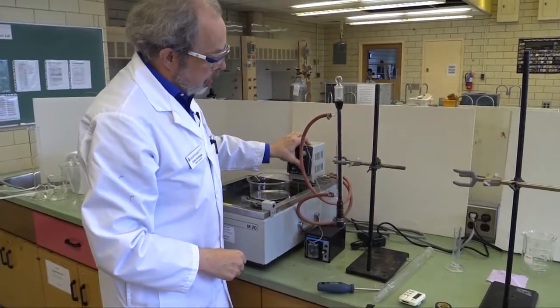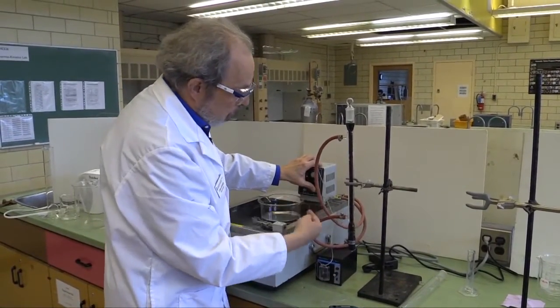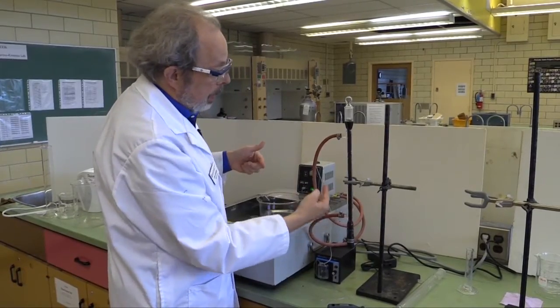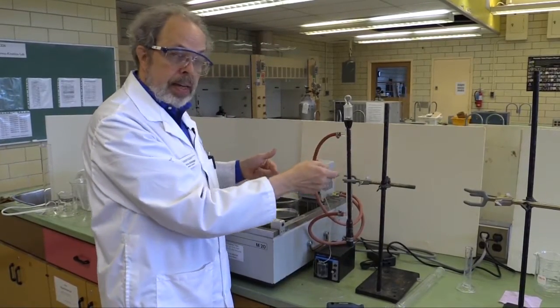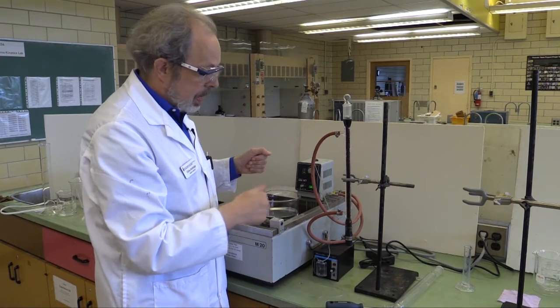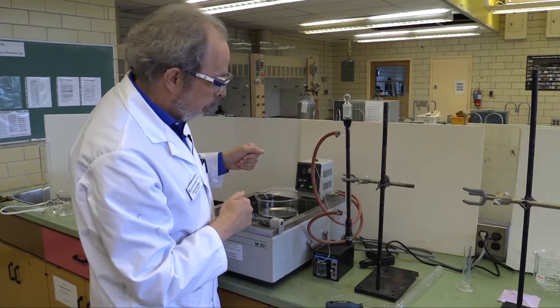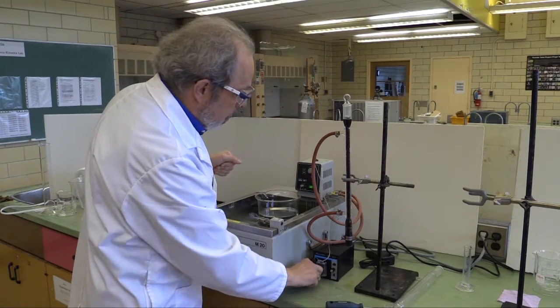Now at this point, you can turn the water bath back on, and you notice that the water, which was shooting back into here, is now filling the jacket, and that will keep the reactor at 60 degrees. It'll take a while for it to get up to that point, but while we're doing that, I'll show you about the pump.